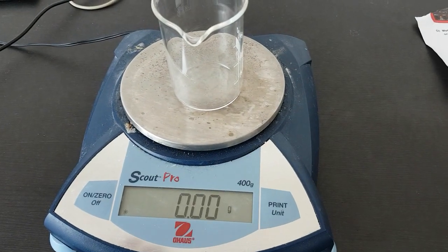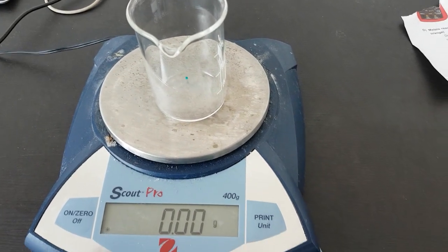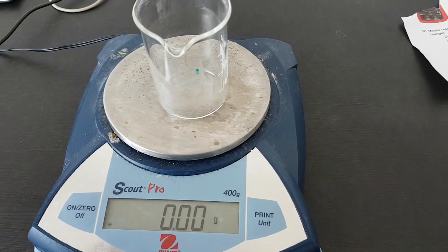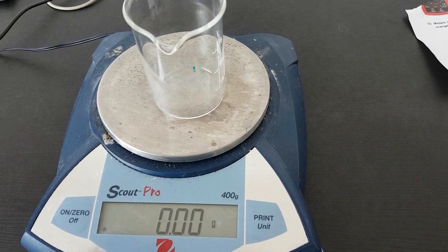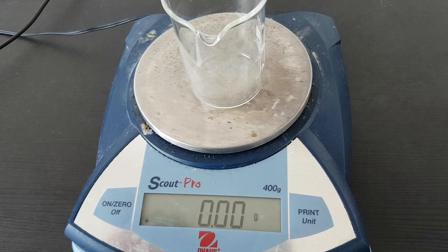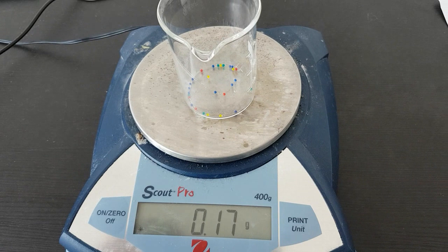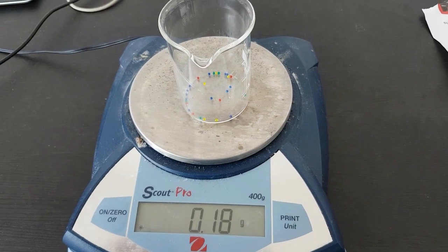I've got the balance. Let's add one teeny weeny one. Okay, so that's not going to work, so I'm going to have to weigh more than one out and then do a little bit of maths. All right, that seems like enough for now.